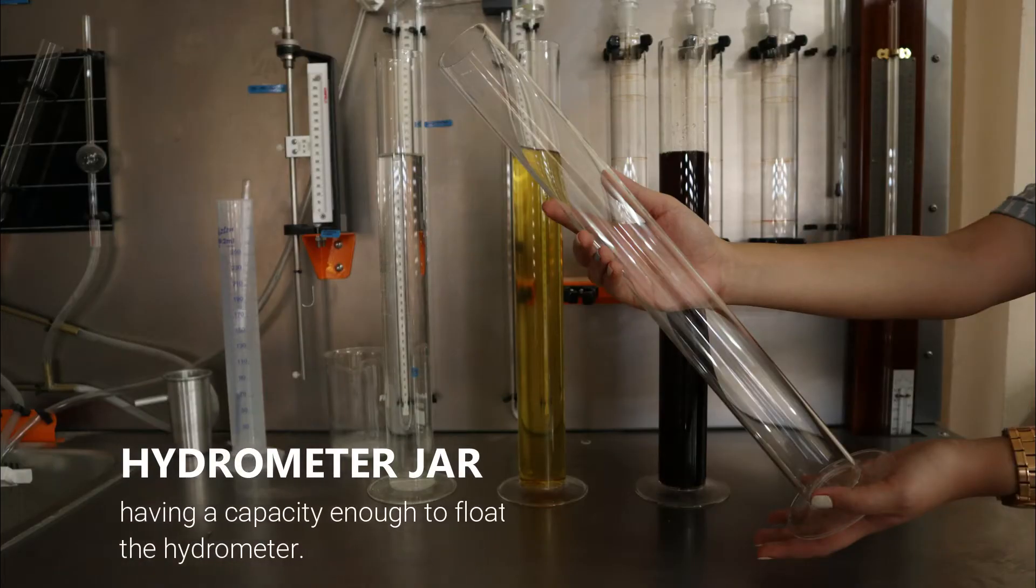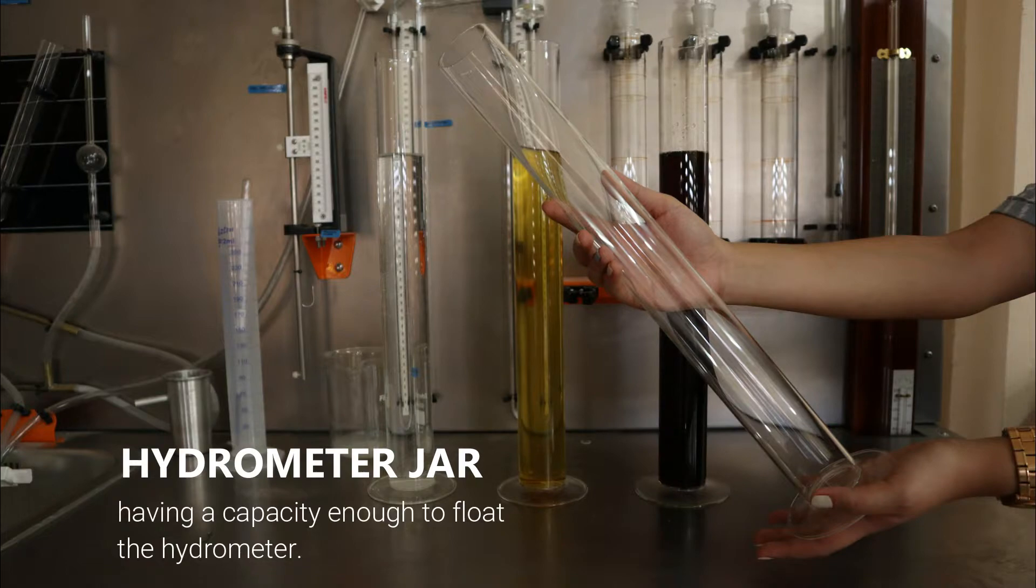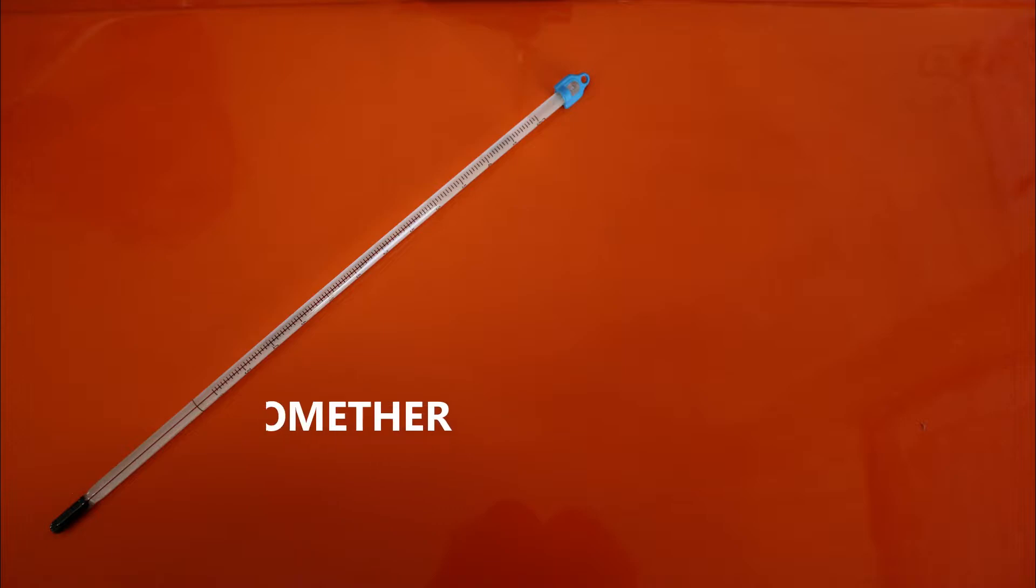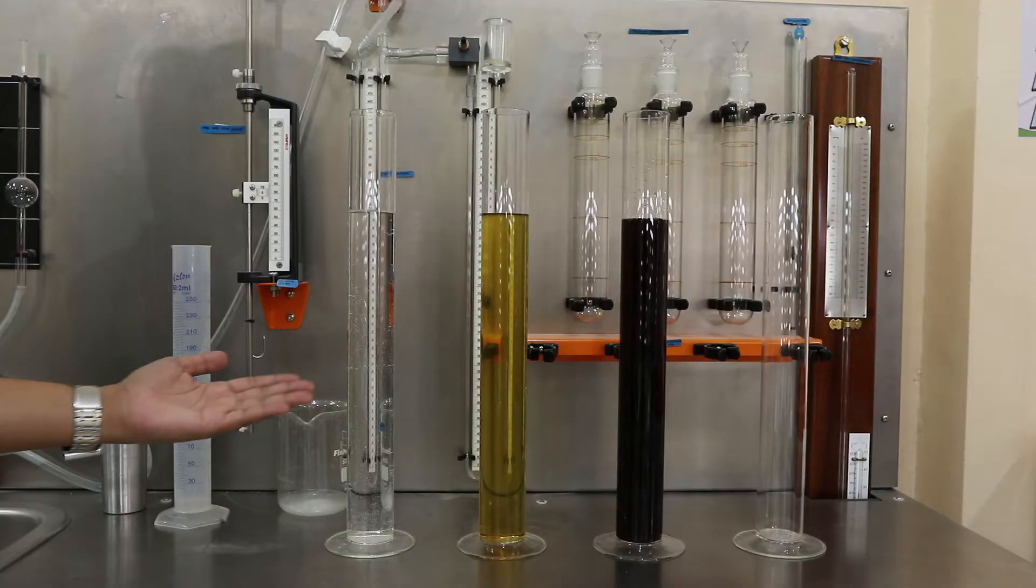Hydrometer jars, which has the capacity enough to float the hydrometer. Thermometer, it is an instrument that measures water temperature. And suitable liquids for testing.